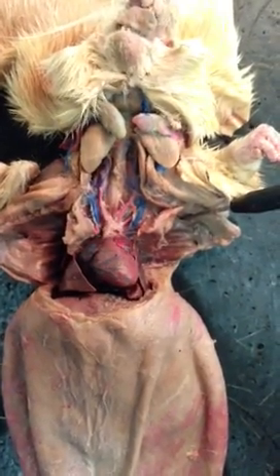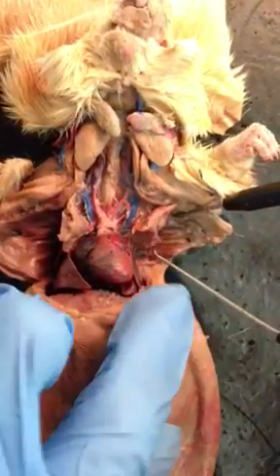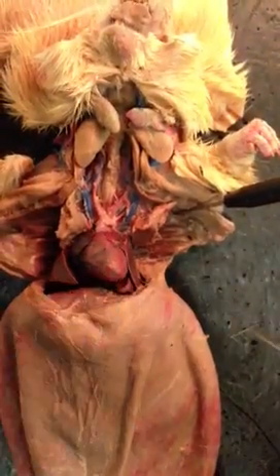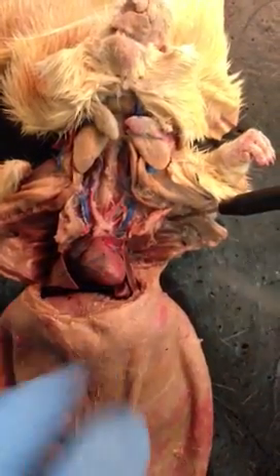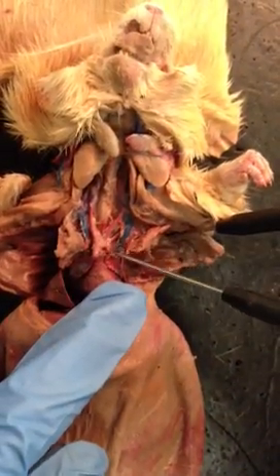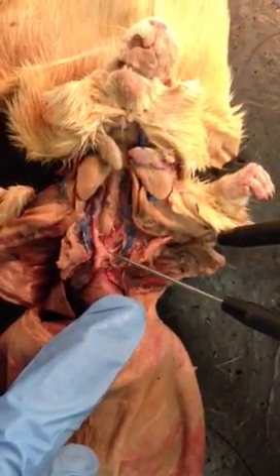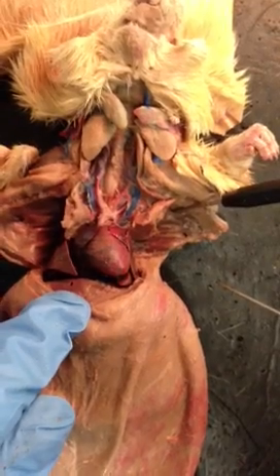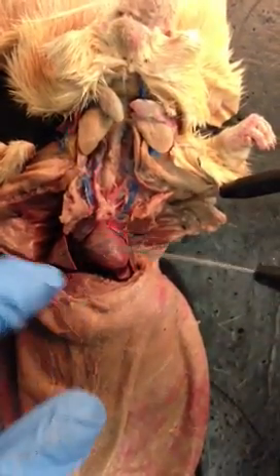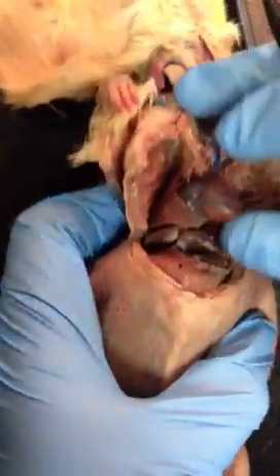Okay, and the ventricles. So this is the right ventricle, that's blue. The left ventricle is red. Okay. Aorta. The aorta is this, this is just the vein right there. And then the inferior vena cava. Inferior vena cava, above the diaphragm under the heart. It's right there.